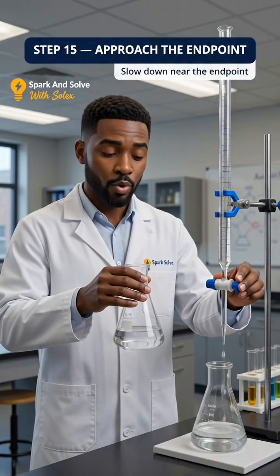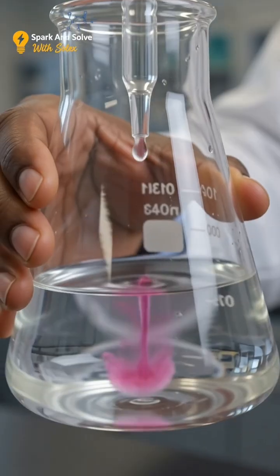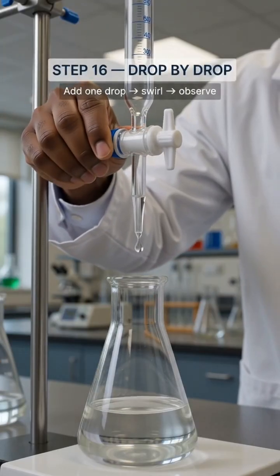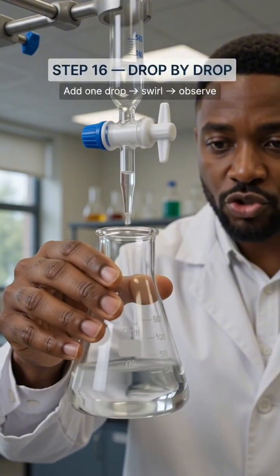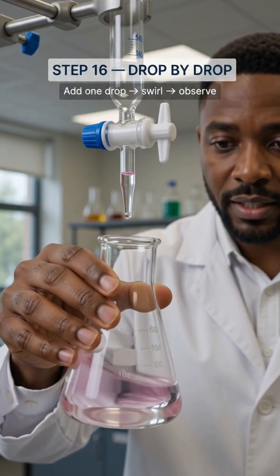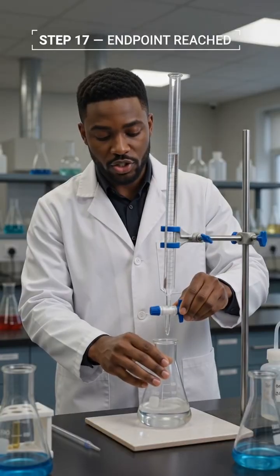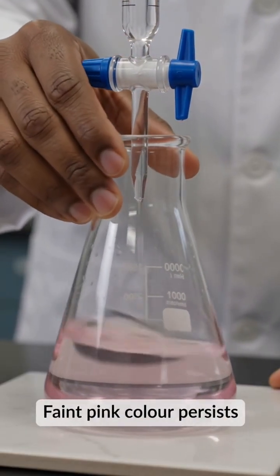As we approach the endpoint, slow the addition and add the sodium hydroxide more carefully while continuing to swirl. Near the endpoint, add the sodium hydroxide drop by drop, swirling after each drop and watching the color carefully. The endpoint is reached when one final drop produces a faint pink color that remains after swirling.